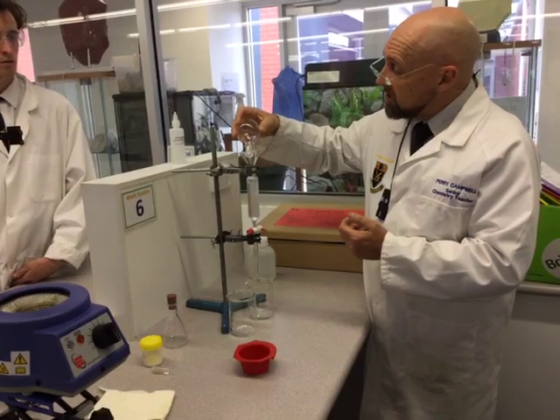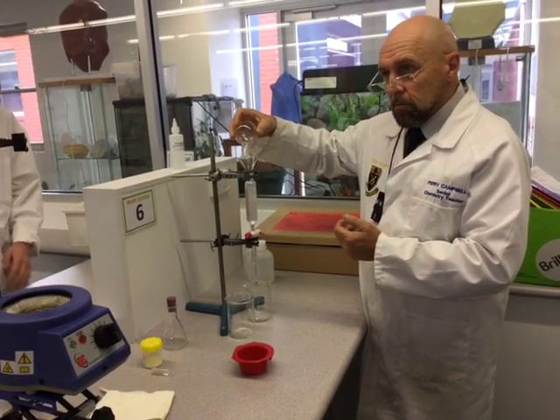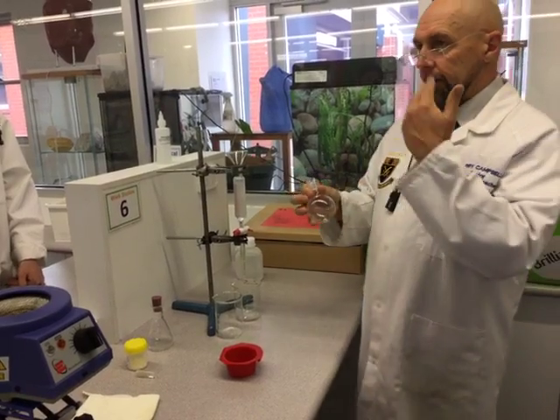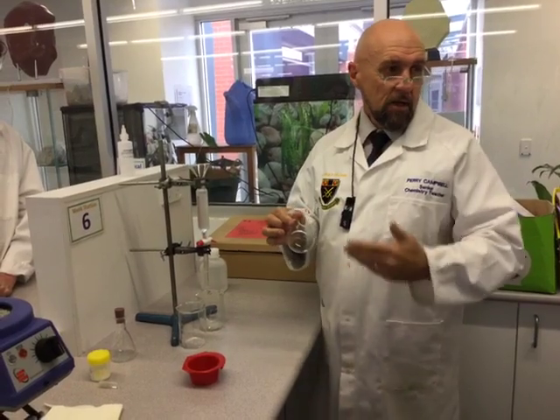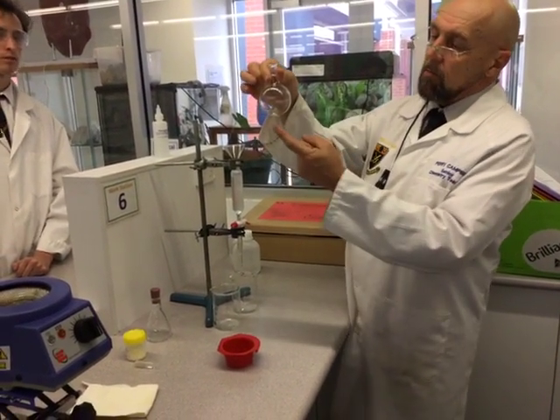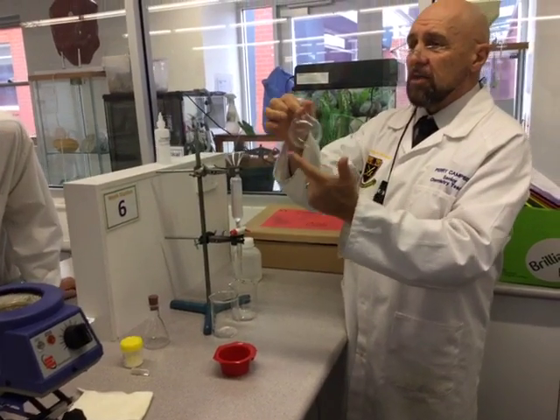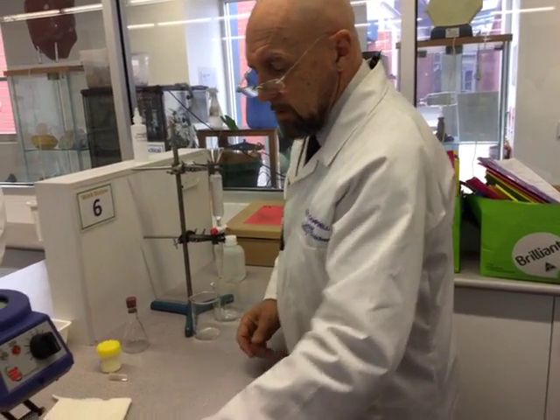Although we haven't got smell-o-vision, what are you smelling at the moment? Nail polish remover. It's a little bit like nail polish remover. What happens towards the end of an ester practical is that your receptors in your nose sort of get dead to everything — you just don't smell anything, because you've been in a lab and everything pongs pretty badly. So I've got most of it out there. A small amount left in, okay? I'll just need to rinse this with water and get that ready for our distillation, which is going to happen in the next step.